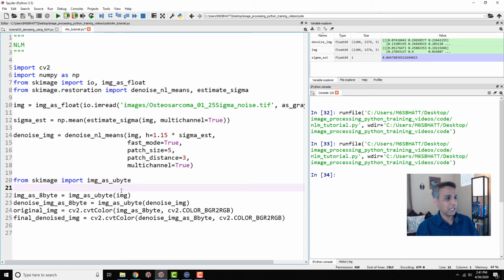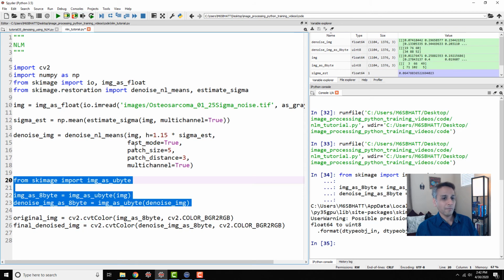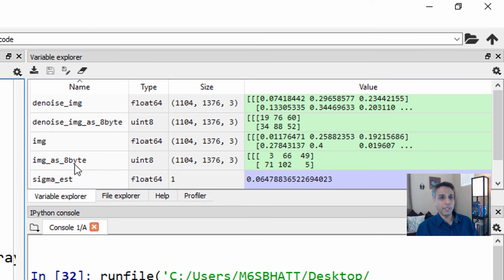The library that I use is again scikit-image. I'm going to import img_as_ubyte. This converts our float into 8-bit. That's all it is. So I'm converting both my input image and the denoised image into 8-bit. If you run these lines and look up here, you see how I have my image converted to unsigned integer 8. So now it's ready to be saved or visualized.